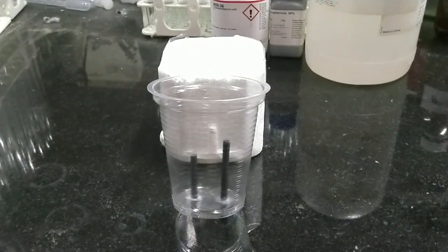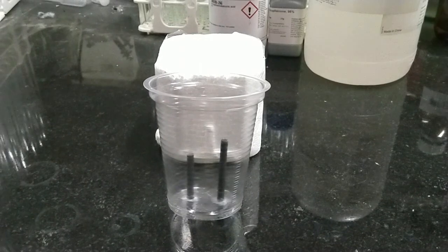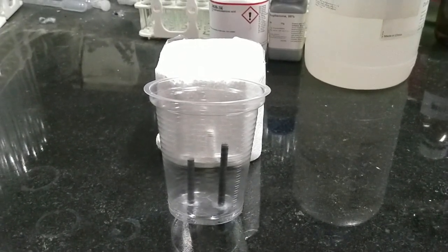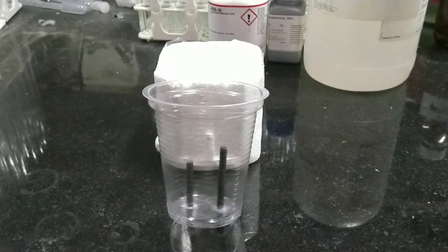Welcome to another video by MatKeyMister. Today we are going to run a simple electrolytic cell using the electrolyte sodium chloride solution.